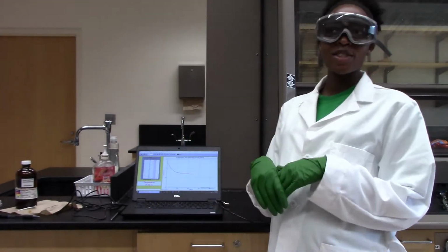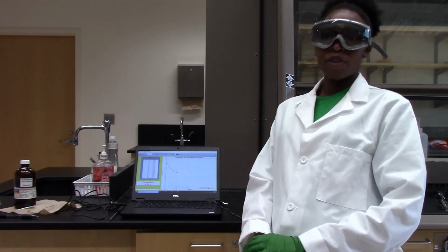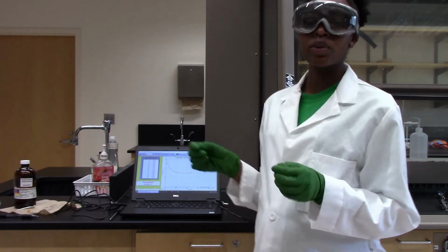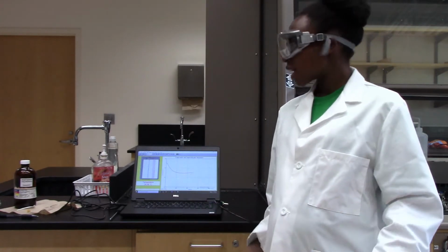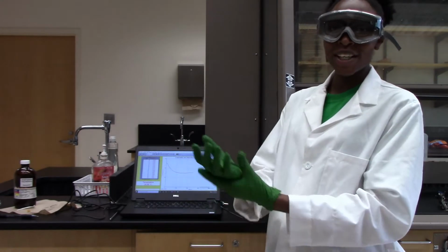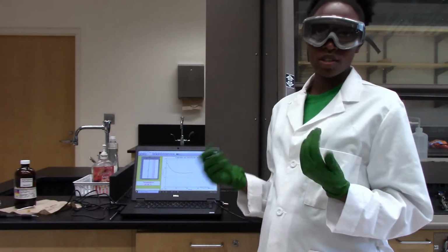Hey guys, so in this experiment we are going to examine the concept of evaporation. You guys have definitely seen water boiling or just something evaporating. That means the liquid molecules are escaping into the gas phase. And so with this experiment we have 7 related compounds that we are going to examine the evaporation of and determine the relative strengths of the intermolecular forces of attraction.